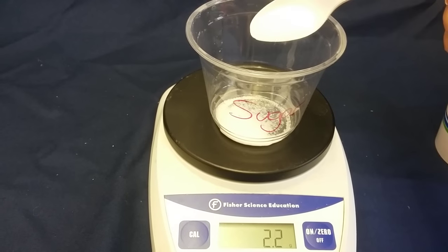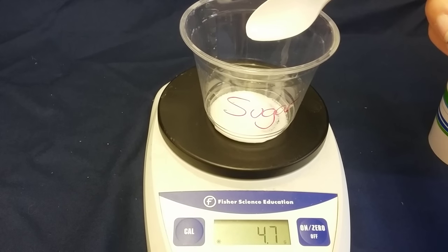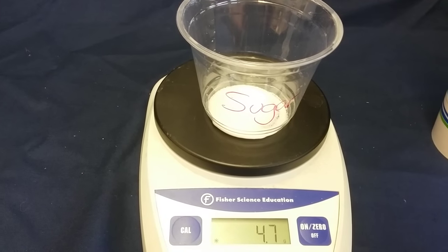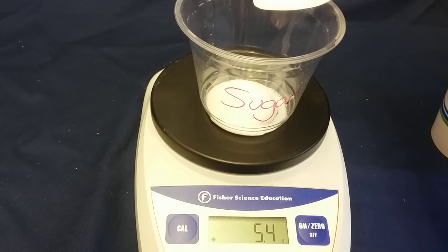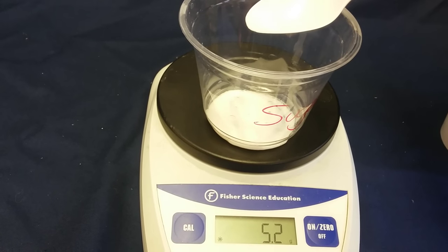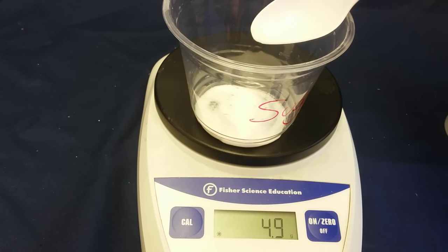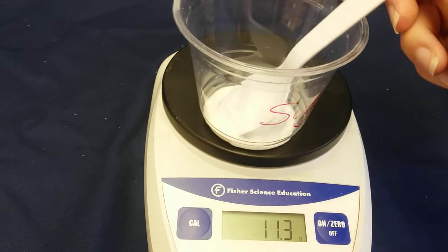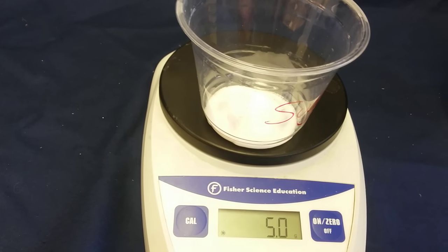I'm going to add a little bit at a time. Oh dear, I've passed it. So I need to take a little bit out. Very very close. And now I have 5 grams of sugar.